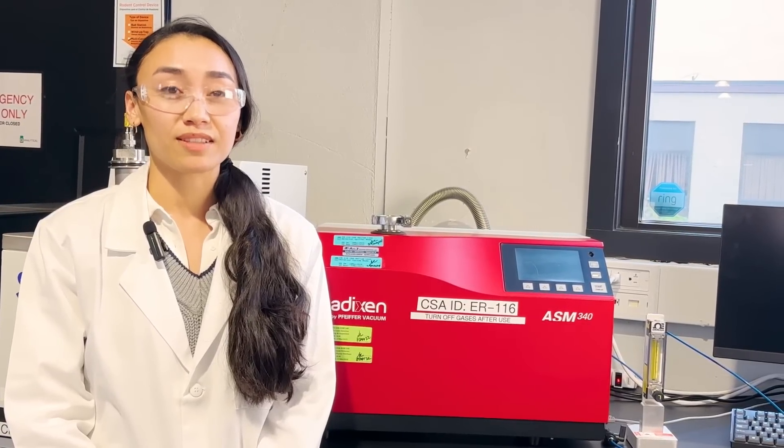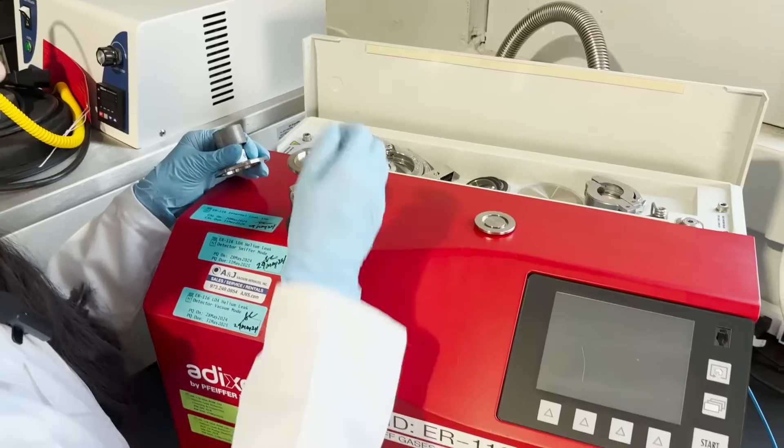During the test, a vacuum is pulled and the sniffer probe is allowed to read the ambient levels of helium as a baseline. The sniffer probe gas collection tip may then be brought around the seals of interest of the helium-filled package. Recording that baseline prior to scanning the package allows for observation of any increase, indicative of the leakage pathway. Sniffer mode leak detection can be used on a large range of sample types, such as large flexible package systems, to pinpoint leakage locations.